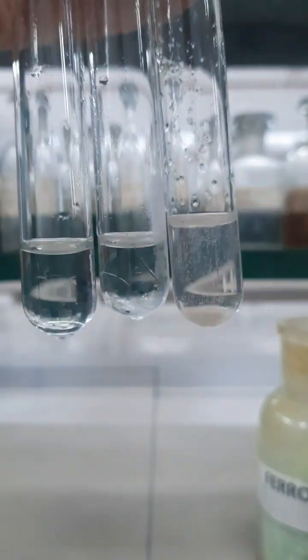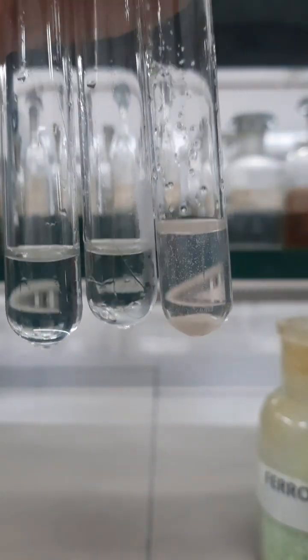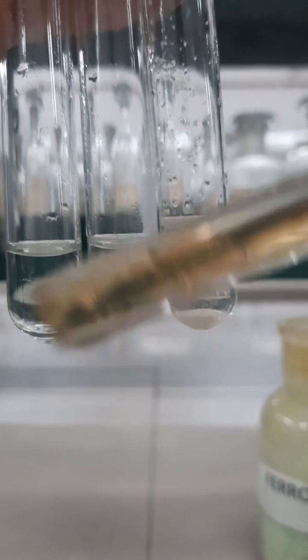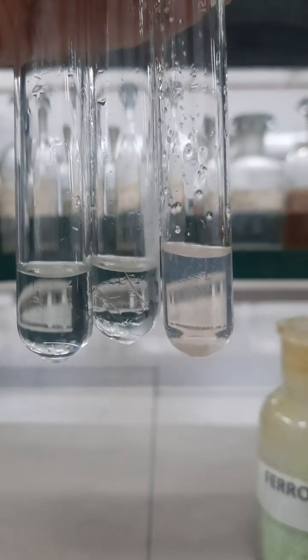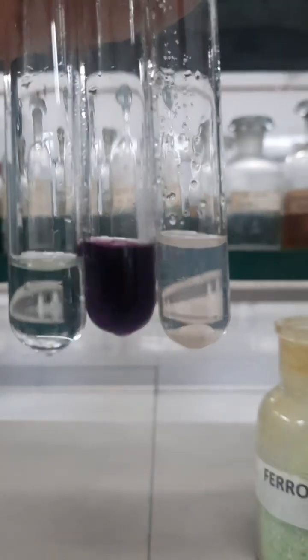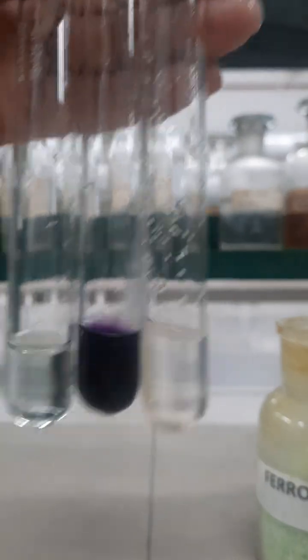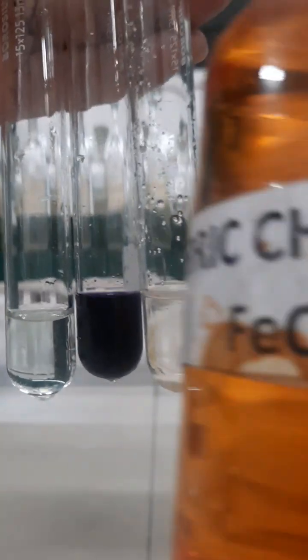Now I am adding sodium nitroprusside solution into the second test tube. After adding sodium nitroprusside solution, a violet color solution will be obtained, which confirms the presence of sulfide in the sodium fusion extract of thiourea.